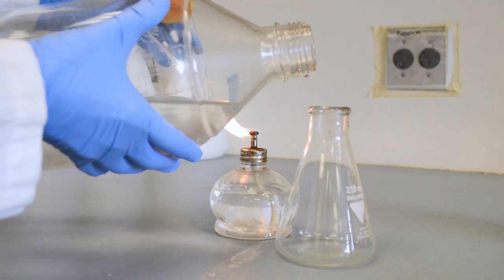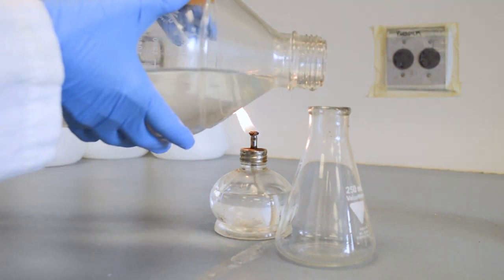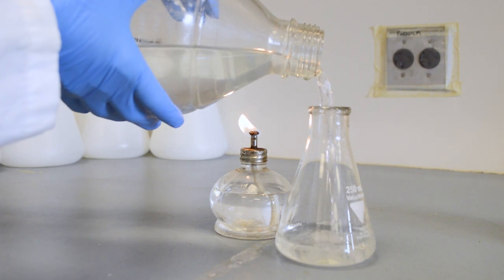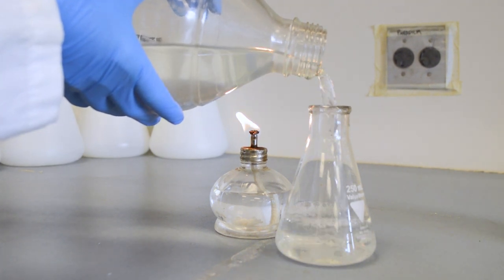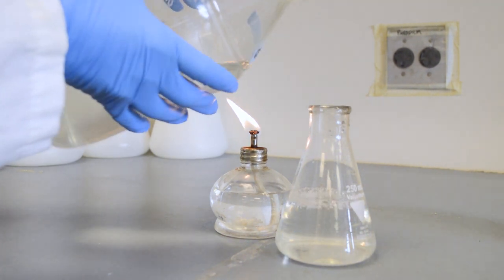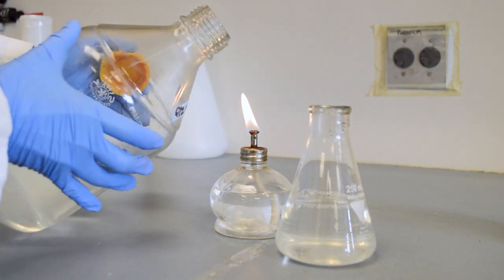Pour media from the bottle into the new flask without touching the media bottle to the flask. Don't worry if you spill, it is better to lose some media than risk contaminating the whole bottle. Make sure that you do not overfill the flask as it will be hard to flame the mouth later.